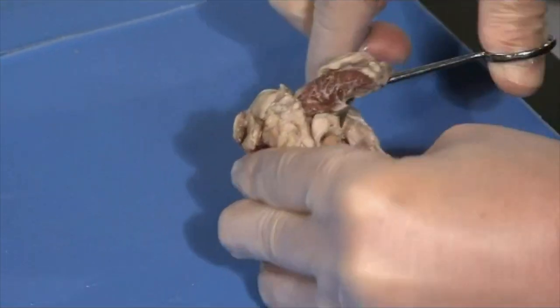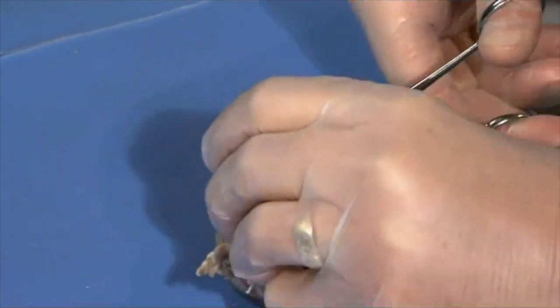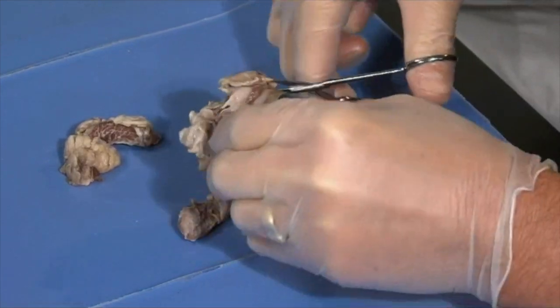Well, first you just have to start trimming this up, and this is not fine work by any stretch of the imagination. We'll just start cutting away that muscle and maybe the fat. The only thing is it's kind of hard to hang on to, slipping, as far as kids cutting themselves. Yeah, you'd have to be careful. Cut away from yourself. Maybe don't even cut off smaller pieces than what I'm doing if you've got time. But you just have to have some patience and keep cutting away that tissue.